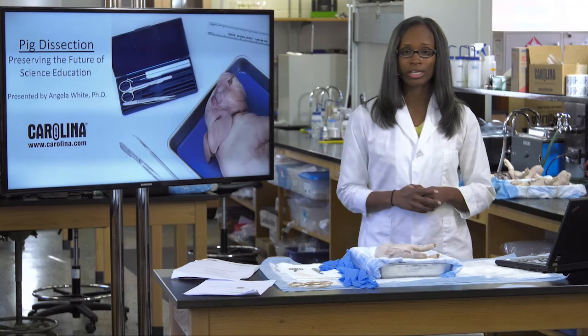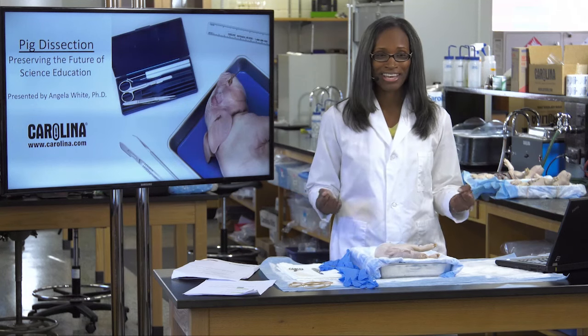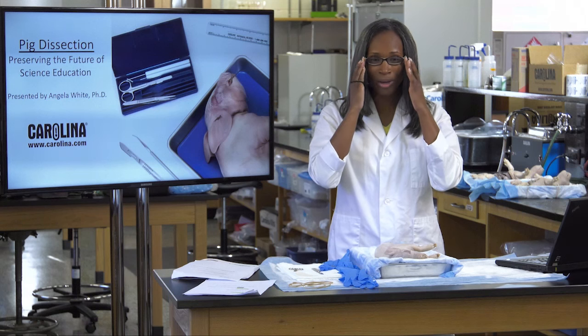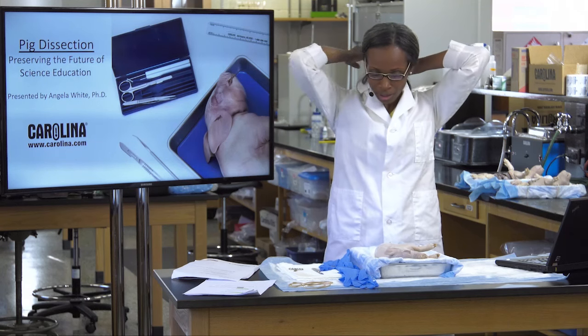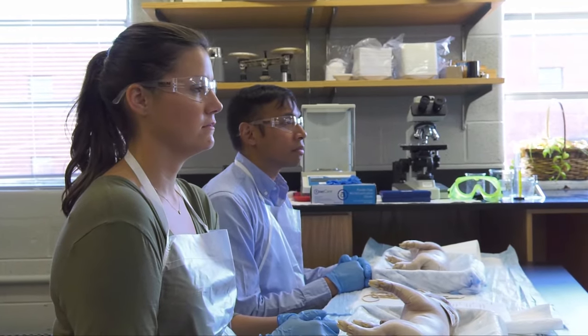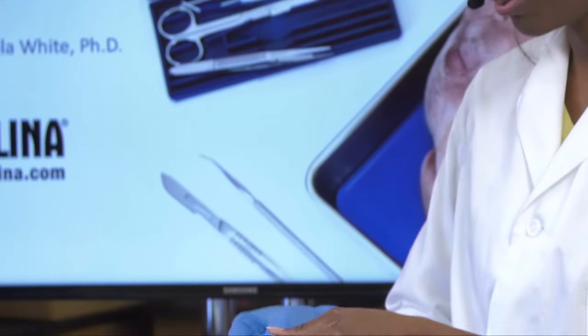Before we leap deeper into external anatomy, we want to gear up for this experience. If you're looking at me today, I have my hair down — that wouldn't be appropriate. We want to make sure we have all of our personal protective equipment. Pull your hair back, and make sure you have eyewear — Sarah and Danny have goggles. You can see I'm wearing a lab coat; you may have an apron. We also want to make sure we put our gloves on.